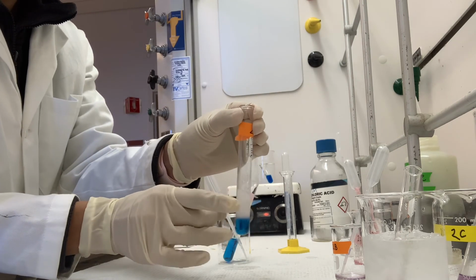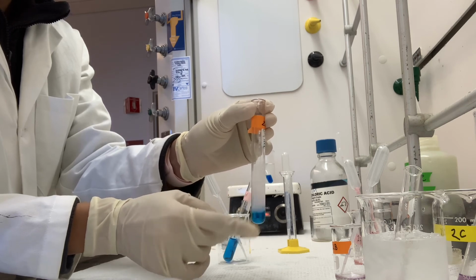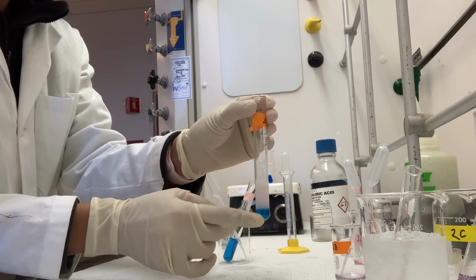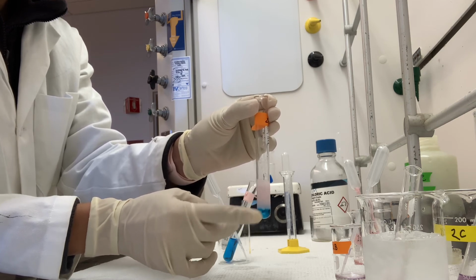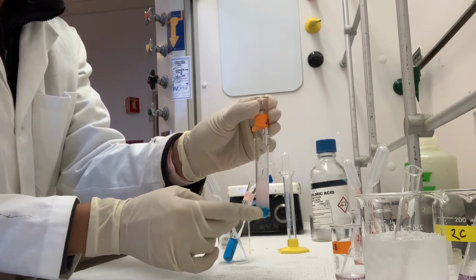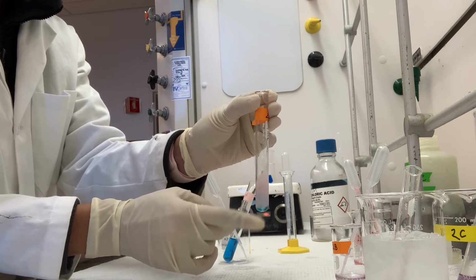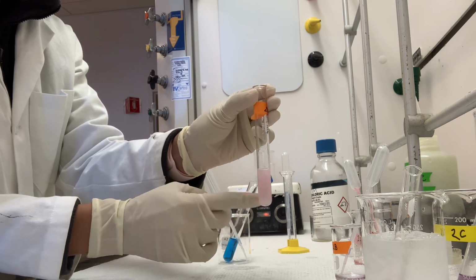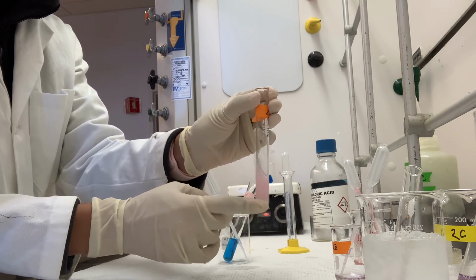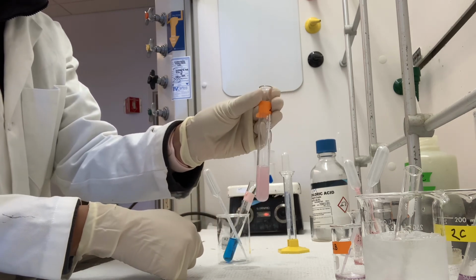And kind of flick the test tube to get it to mix more uniformly. You can see that the bottom of the test tube probably hasn't mixed with my silver nitrate. But the more that I mix it, the more that you see this change happen uniformly over the entirety of the solution. All right.